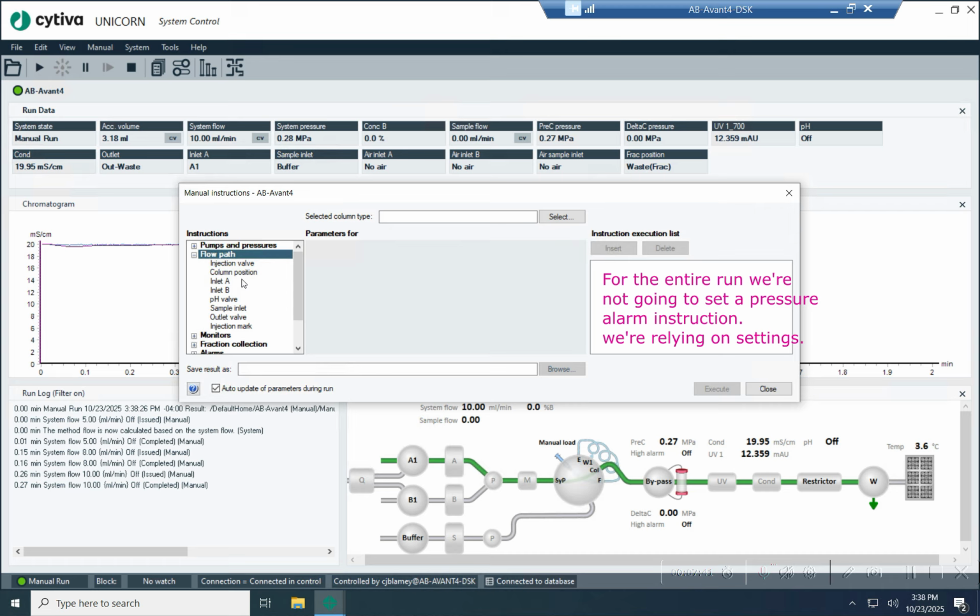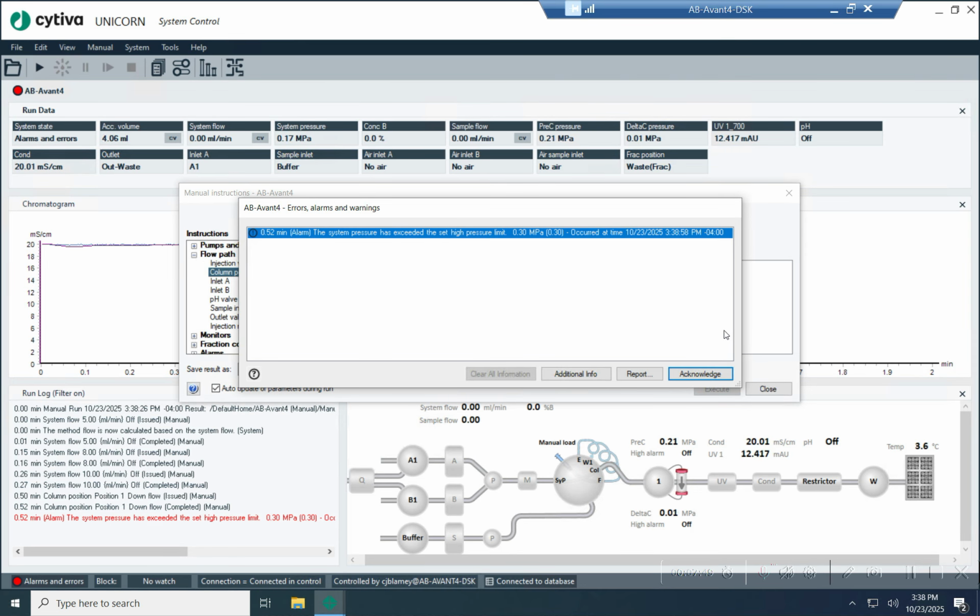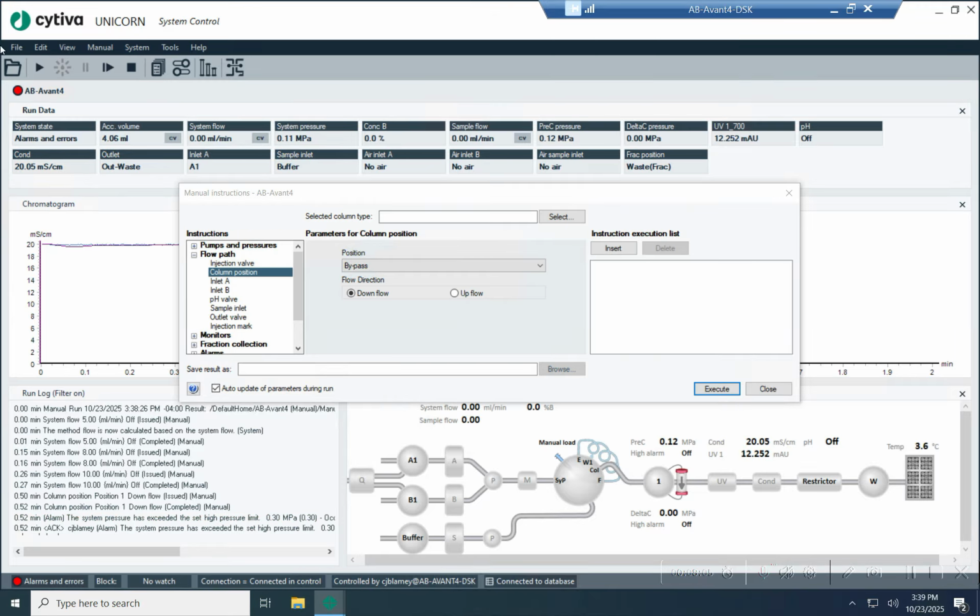So I'm just going to change the flow path to column position 1 where that tube is, and I should trip the alarm. Okay. If you read over the run log here, you'll notice I did not set a pressure setting. So that pressure setting came from the system settings right there. So I'm going to acknowledge this alarm, and then I'm just going to end the run.